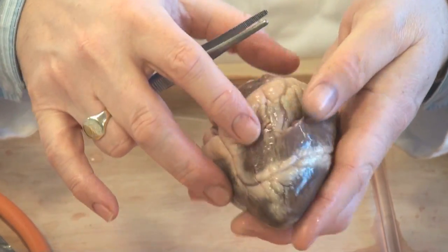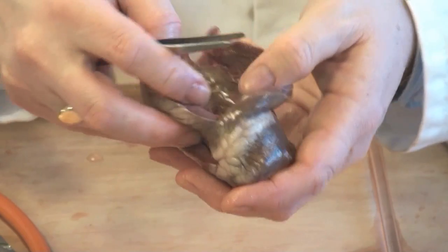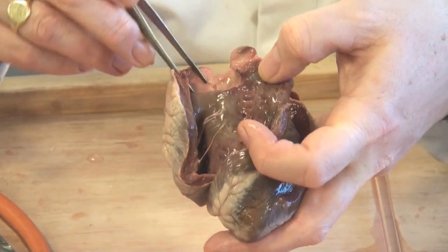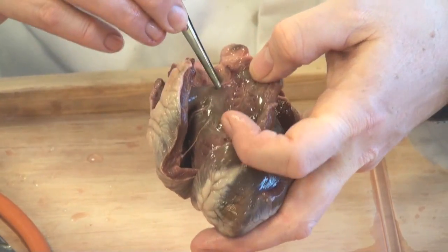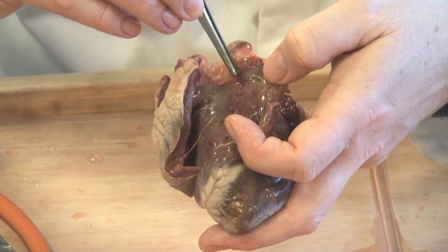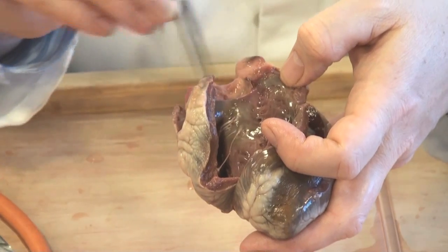The second incision I made, also on that side, was starting in the pulmonary artery, which I've cut right down and butterflied open to get into the ventricle again. The blood will be pumped up this way into the pulmonary artery, and here at the boundary between the ventricle and the artery are the half-moon-shaped semilunar valve flaps — three of them. You ought to be asking students to model how that valve works.